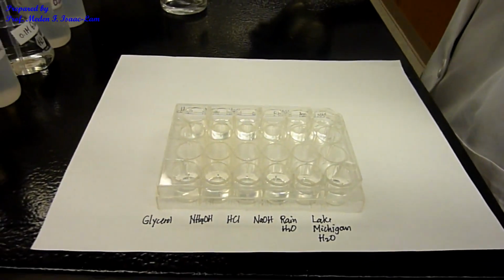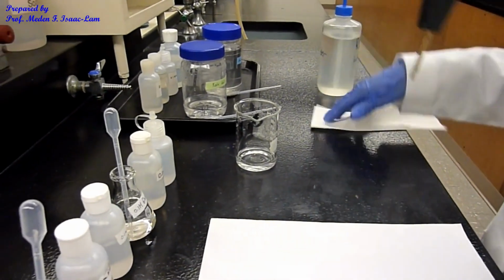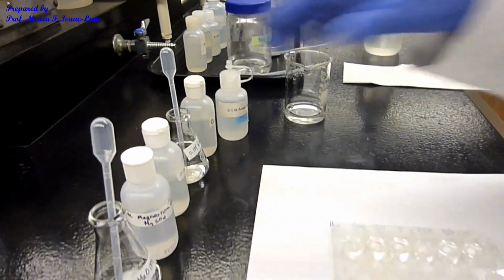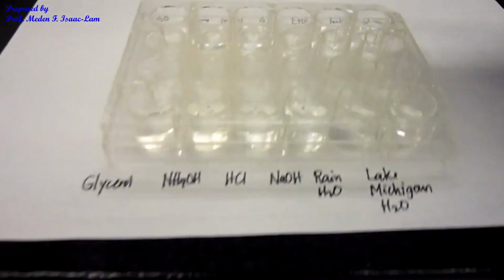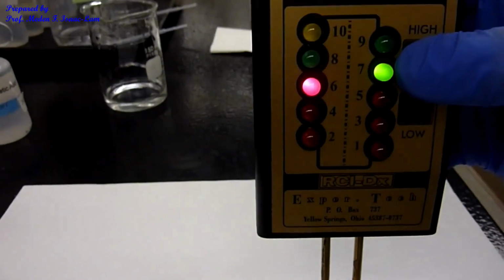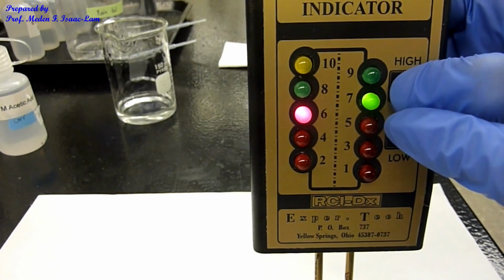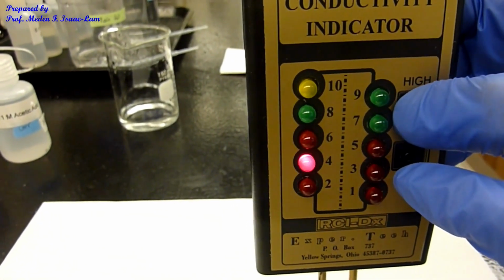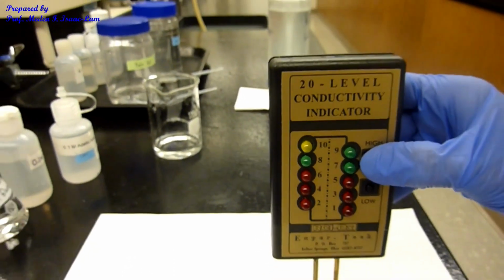Rinse again. Wipe. And then the next sample is acetic acid. Okay. Acetic acid over here, number 6. And acetic acid over here. Press high. And now I'm reading it as 7. So the highest is 7. Oh, I think the battery. So let's do 6. It was 7 earlier, so let's just do 7. Okay?